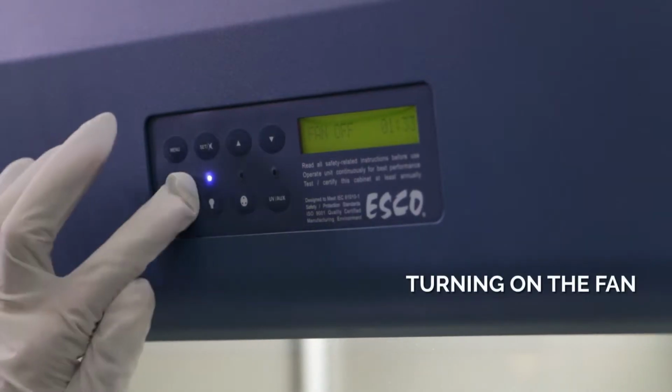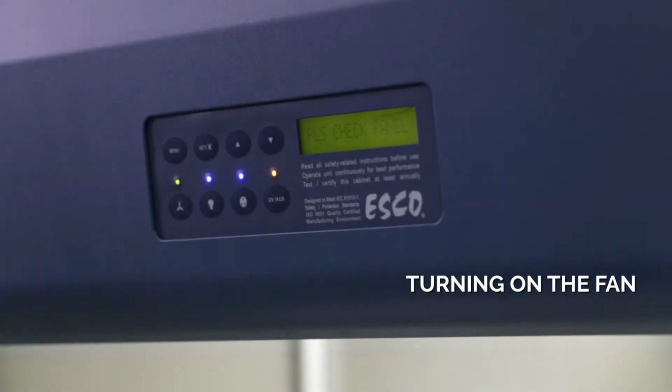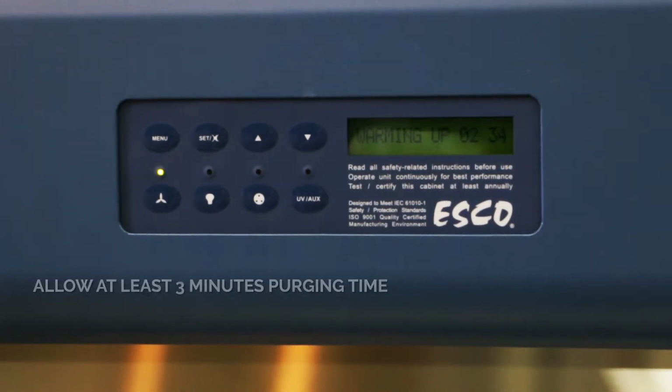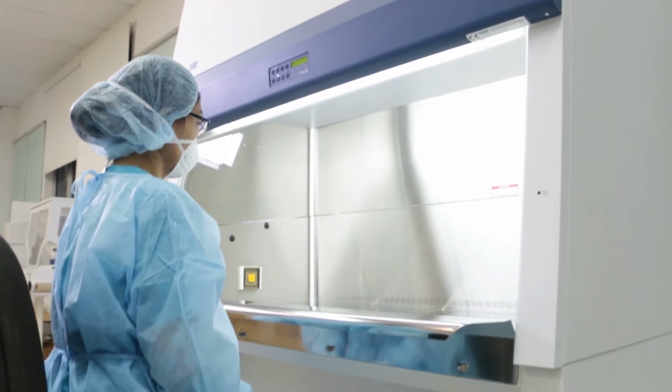Turn on the fan by pressing the fan button. Input the fan pin. Turning on the fan will also start the warm-up procedure. During the warm-up procedure, all the buttons are not operational. Allow the cabinet to purge any contaminant by allowing the blower to operate at least 3 minutes before and after using the cabinet. This is to remove the airborne contaminants from the work zone and to stabilize the cabinet airflow.